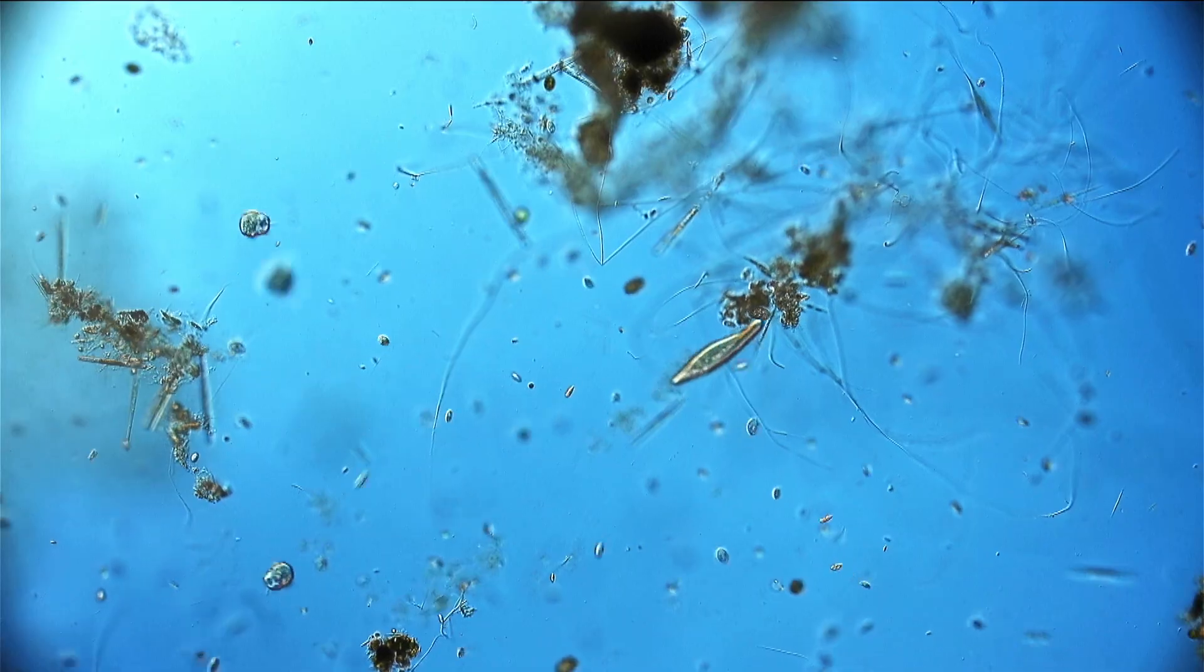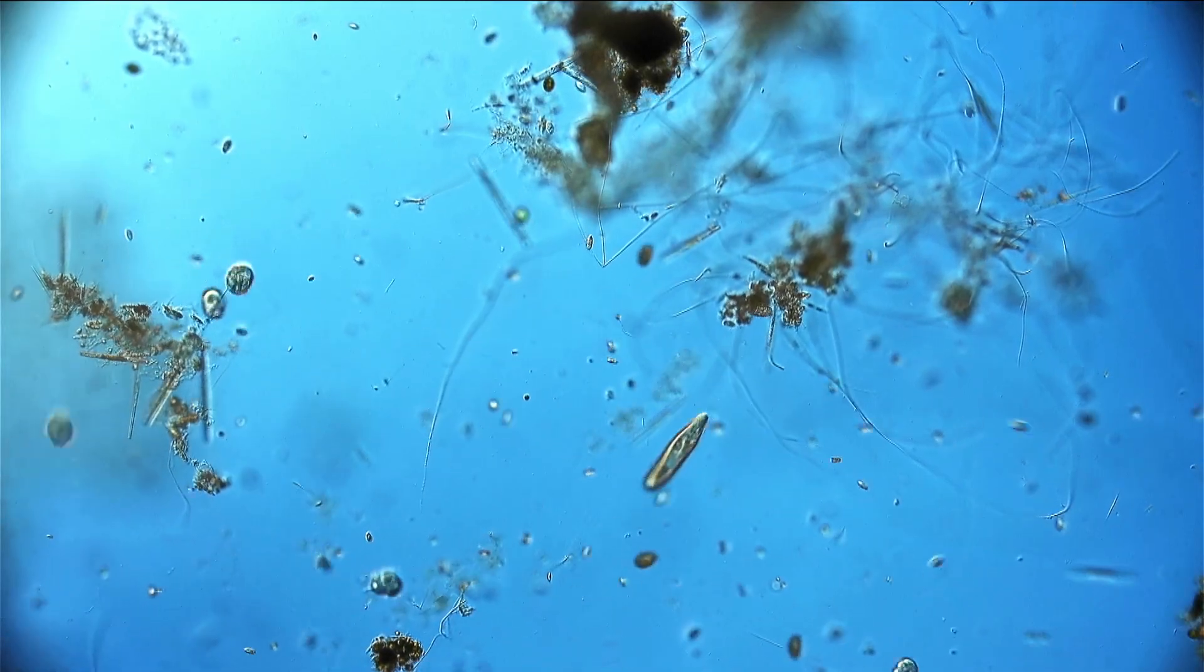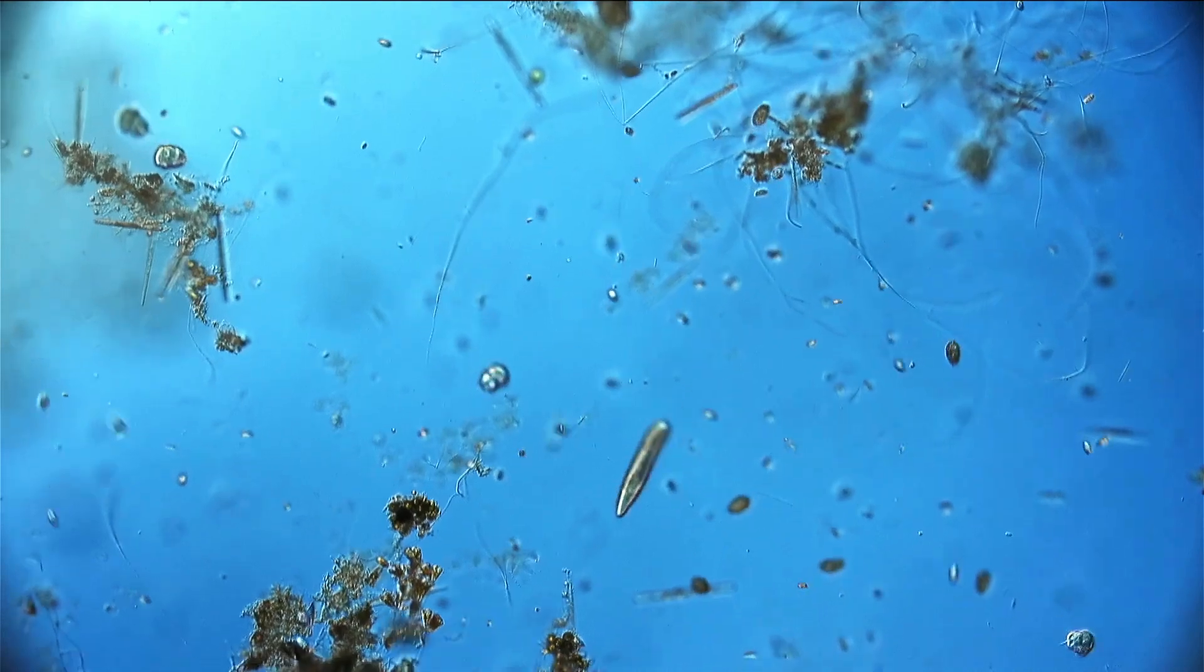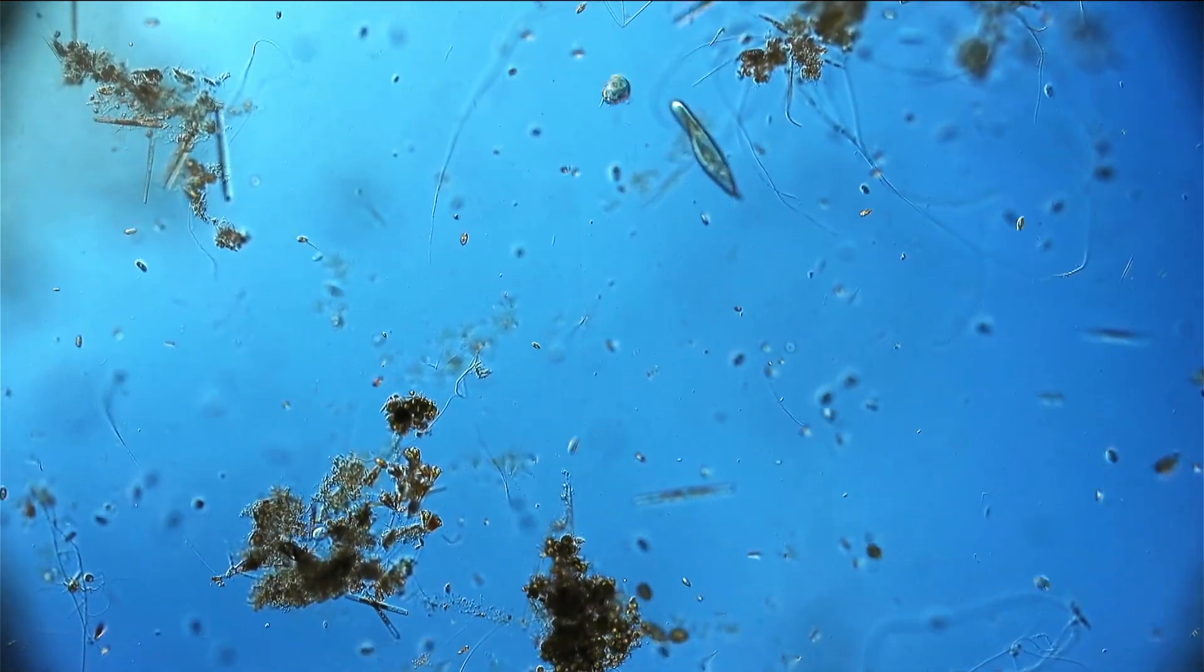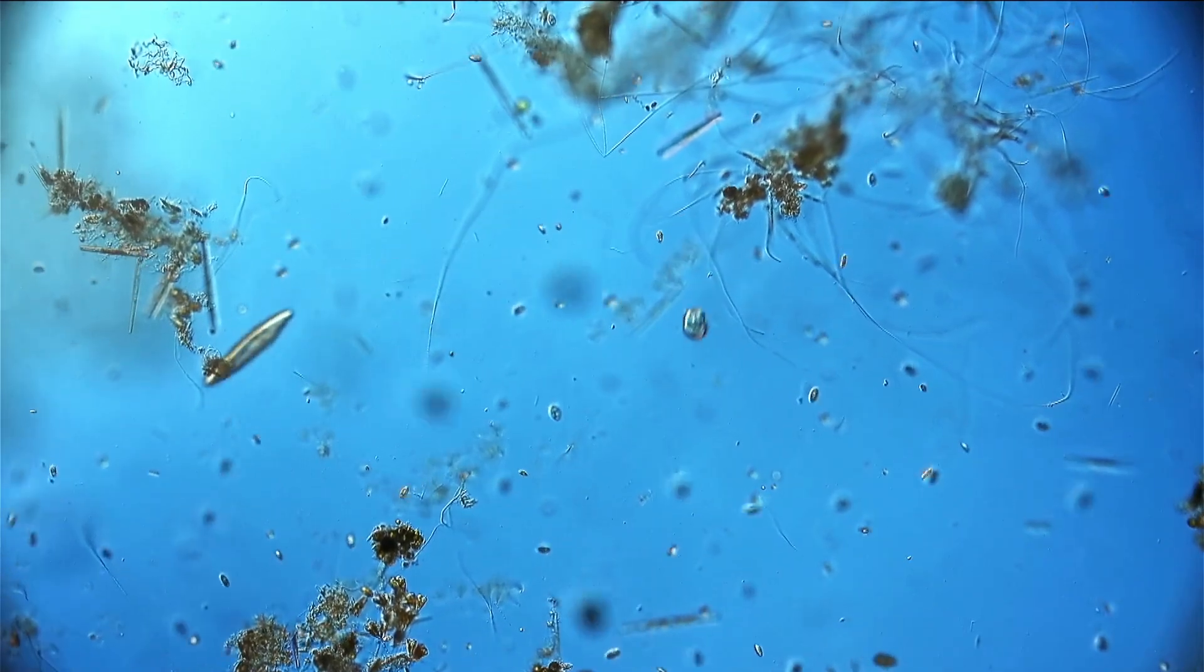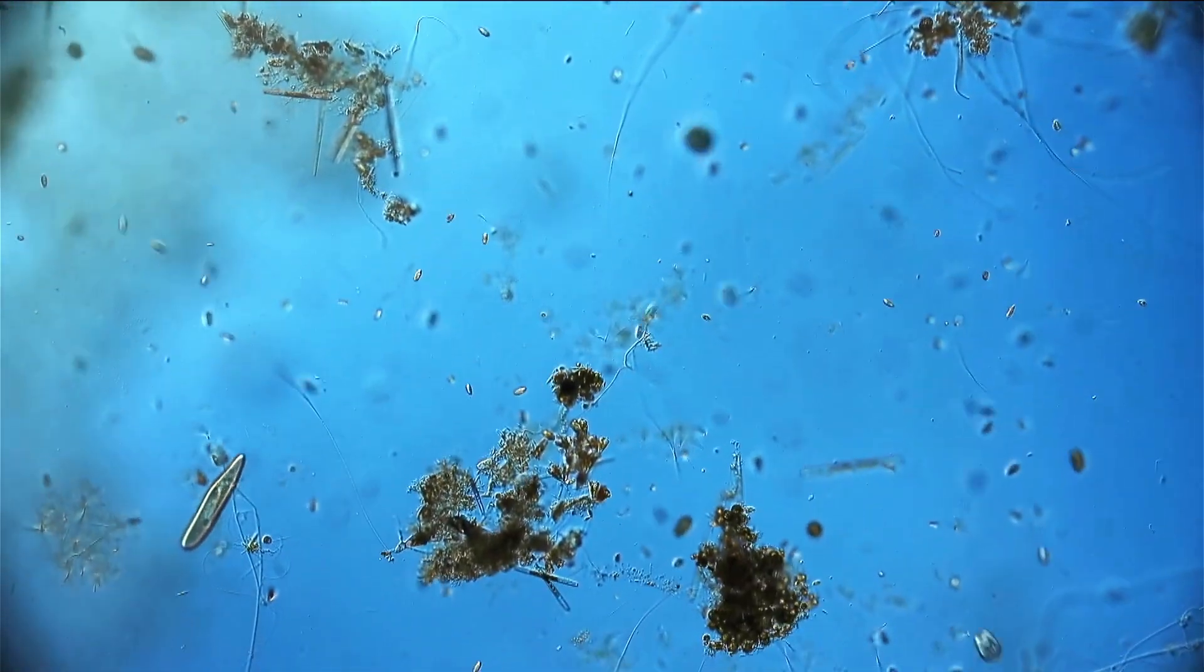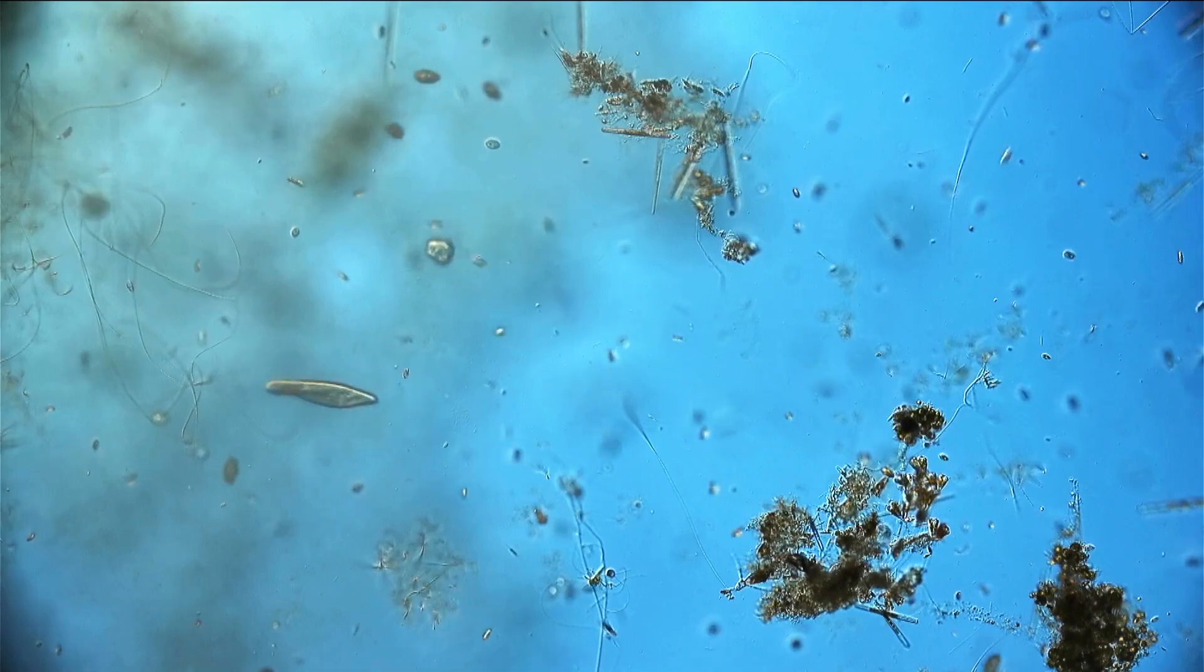So I need to explain the background a little bit here. When you put a water sample under the microscope and when you see those microorganisms, many of them are simply too fast and they like to swim away. As soon as you see them under the microscope they're already gone and it's difficult to chase them and therefore it's also difficult to get a good image or good video.